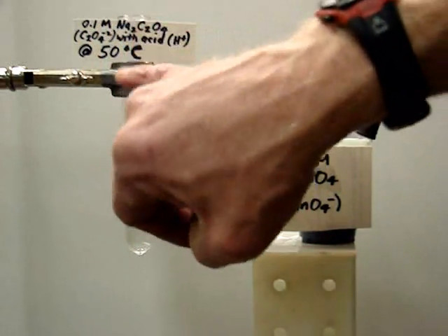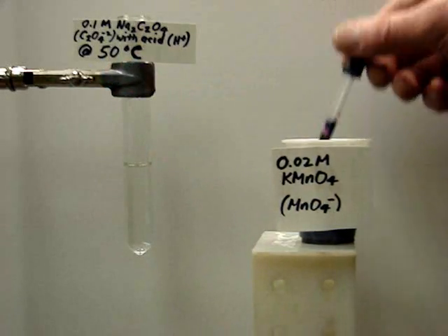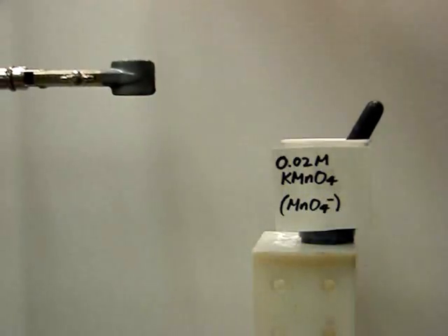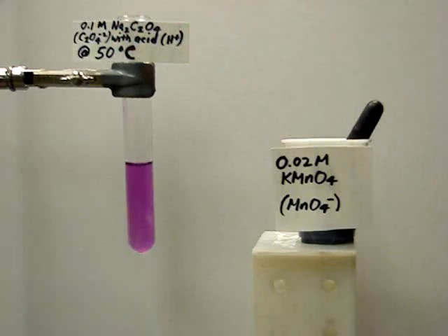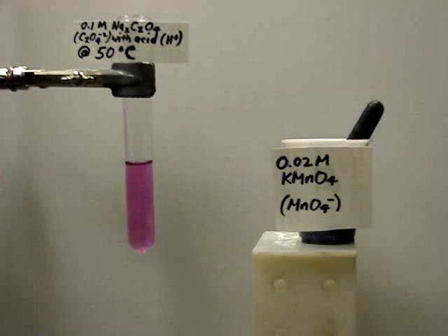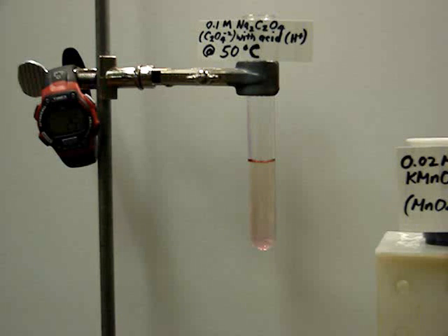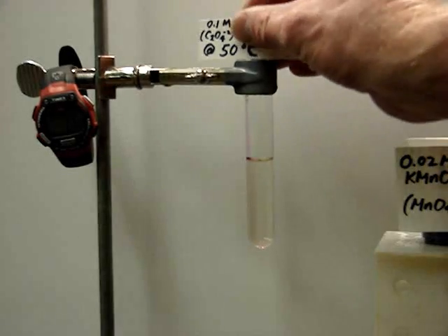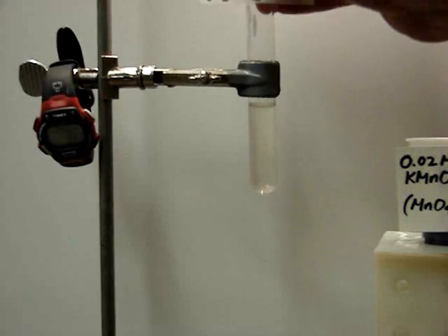Now we'll put some KMnO4 in a solution of sodium oxalate with acid. This time it's a little warmer. It's been in a 50 degree water bath. So we'll put in five drops. Shake it up a bit. We'll let it sit. Notice the purple color has pretty well disappeared now in the solution. We'll just give it a little shake. And we see the reaction's complete.